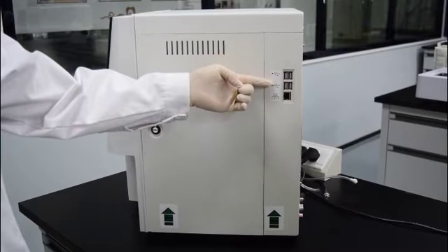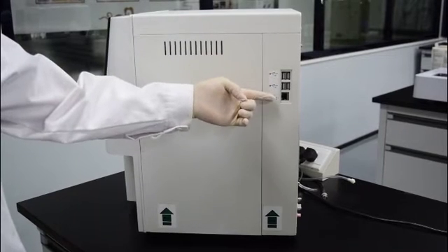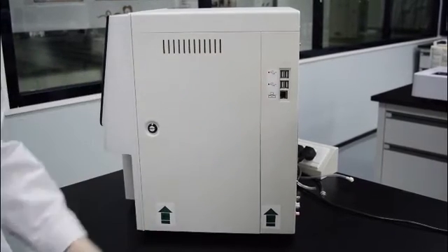On the right panel, there are four USB ports and a LAN port. The LAN port is used to connect with a computer.